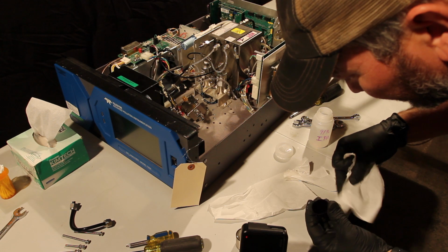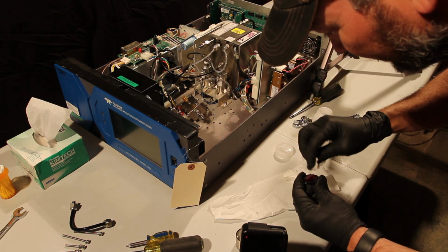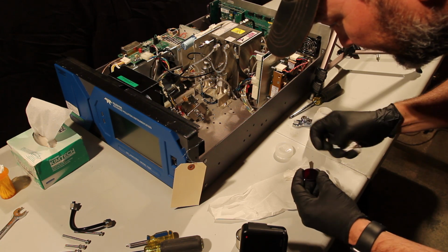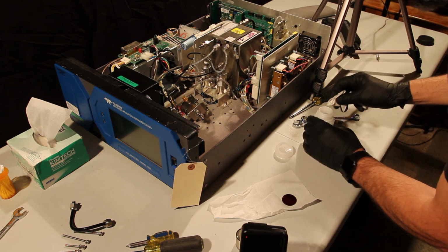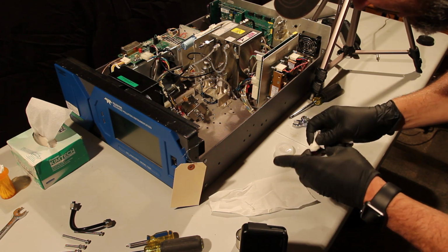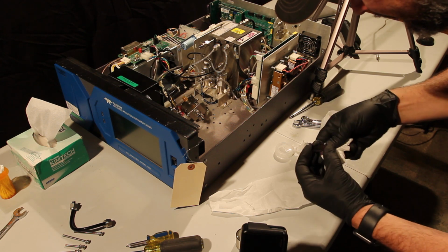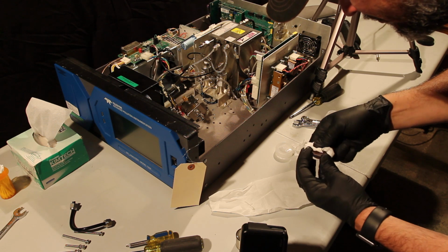The thing that's really important are these gloves. If you've got oils from your skin getting onto this and then you put it back together, you're going to find out that it's going to take a long time to stabilize. The cleaner you can keep it, the cleaner you can get it, the less time it's going to take before you're kind of back to normal and not making those frequent span adjustments or PMT adjustments to your instrument.